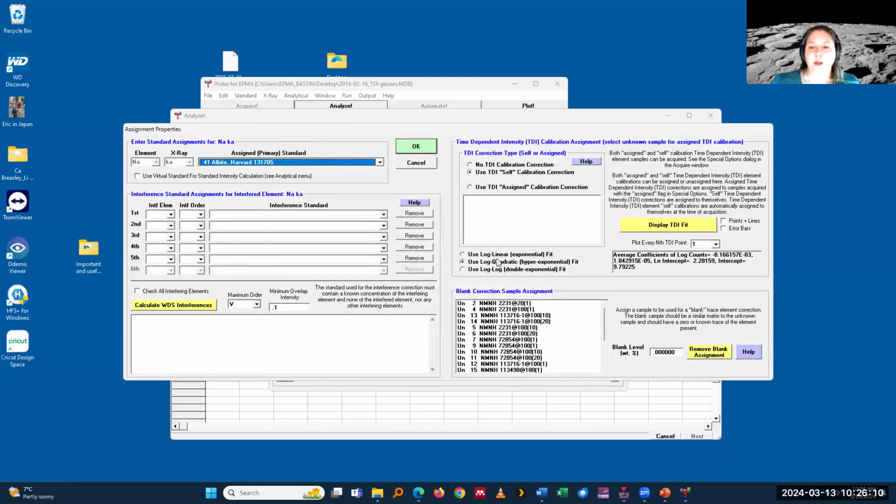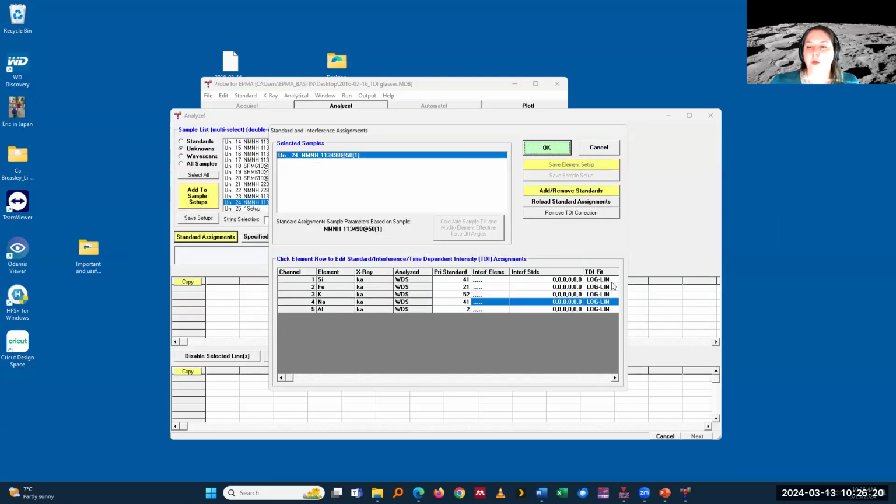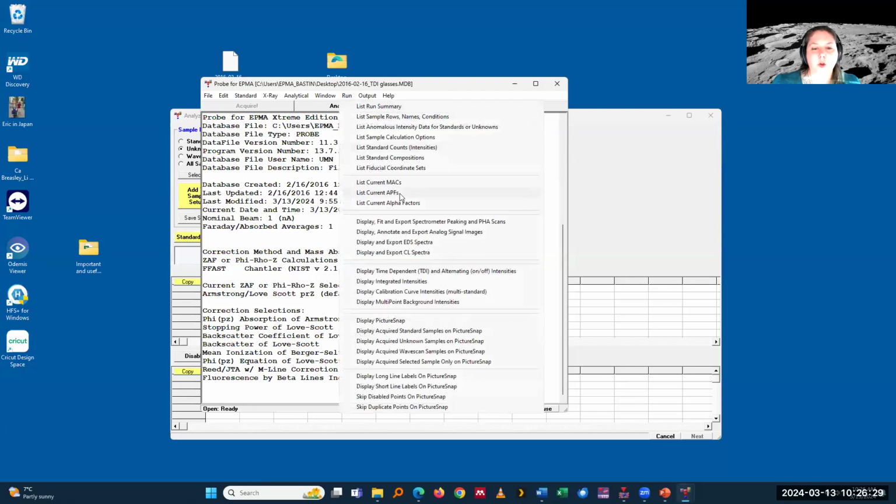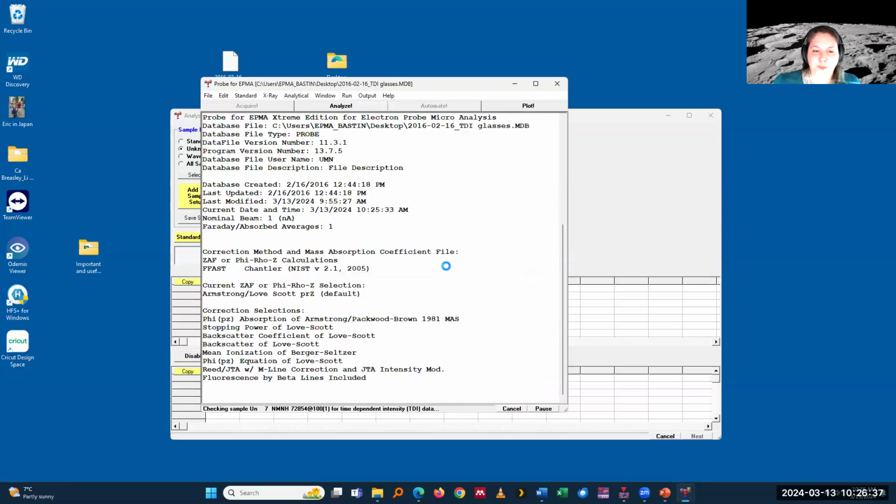So log linear, log quadratic, log log. It's also where I can assign my assigned TDI correction and so on. And here on the right-hand side, it actually shows me immediately what has been assigned. Now, if you go through a lot of data, that can be annoying. And so instead, under Run, you can go into display time-dependent and alternating on and off intensities.